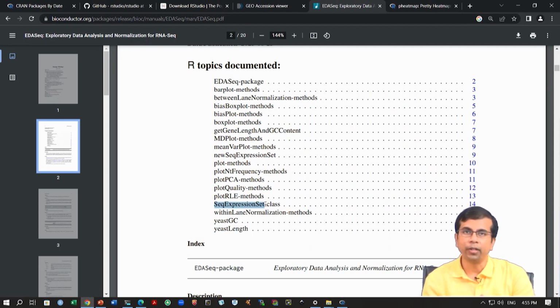Okay, so we'll do that first, and then we'll run this within lane normalization, and then we'll export the data. Okay, in a text file or a tab delimited file, as we have been doing, right. We have seen this count data in a tab delimited file, in a text file. We will do that after we do the bias correction, and we will work with that for differential expression analysis. Okay, so let's try this part.